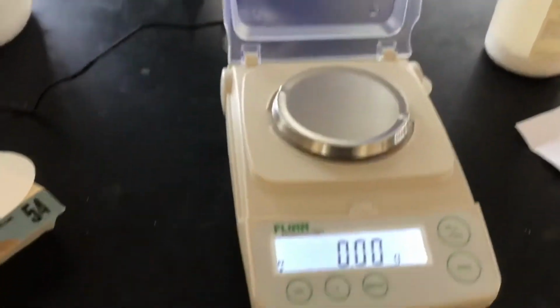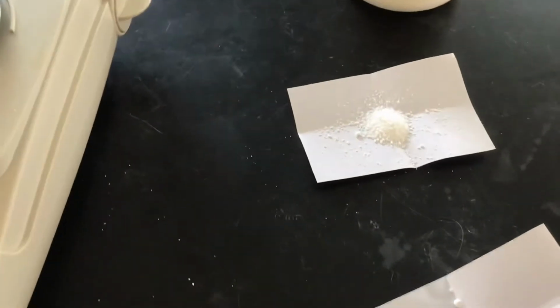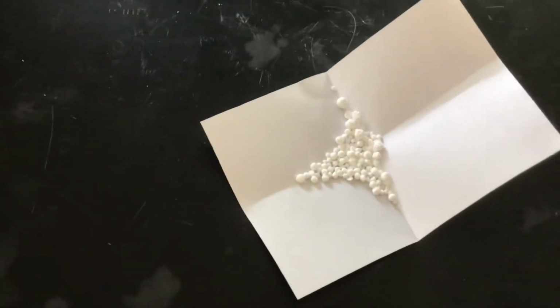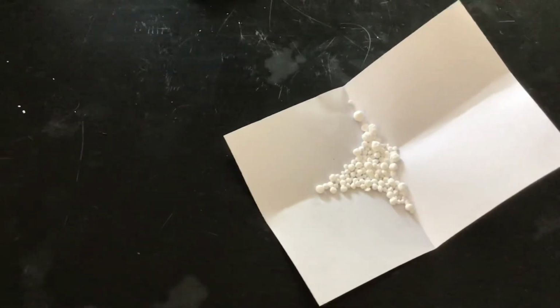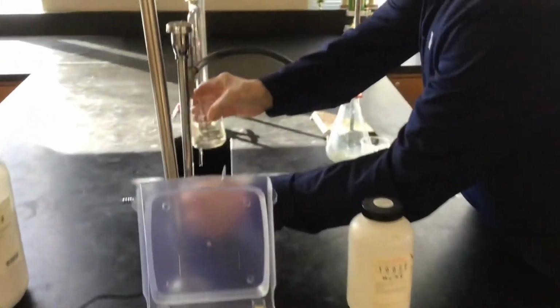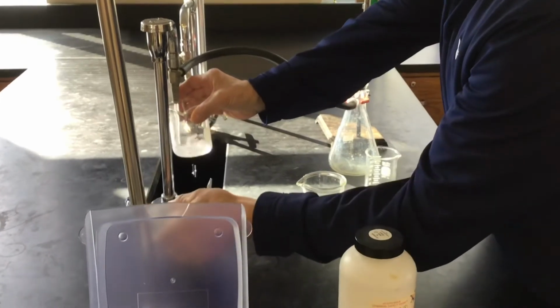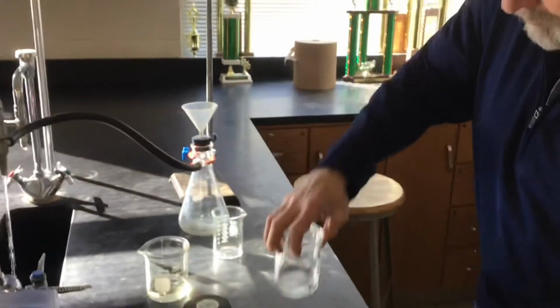Okay, so we've got things set up back here pretty well. Oh, we didn't grab beakers. Yeah, so Mr. Hevel is going to grab some beakers. We have already weighed out 1 gram of the sodium phosphate, that's that one. Then that calcium chloride is kind of a bead thing. We'll just put a little bit of water into each. We don't need to know how much water. The water just provides an environment for this reaction to happen in.